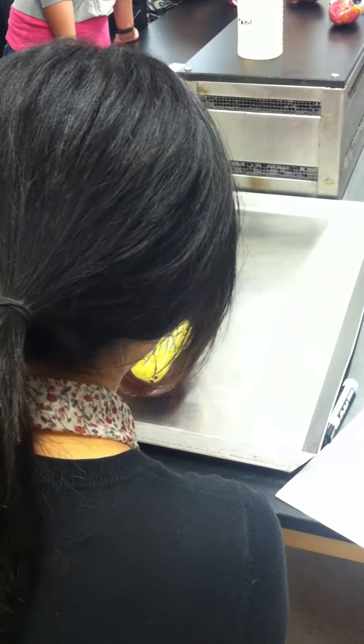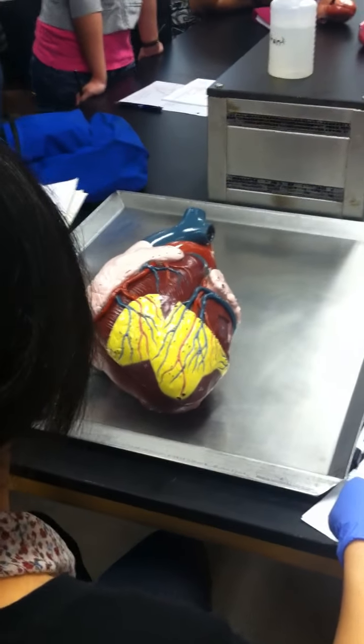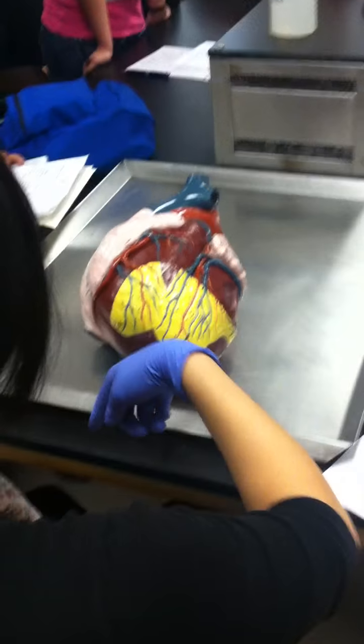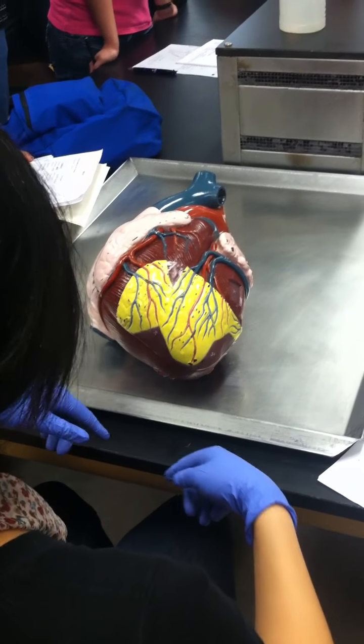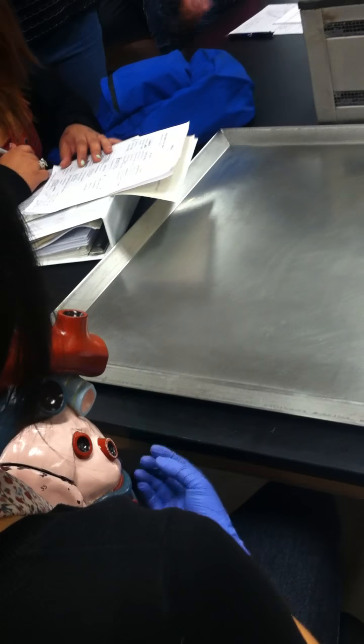Phrenic nerve. Esophagus, we know where it is, so be able to identify that. Sympathetic trunk, azygous vein, hemiazygous vein. I'll show you as we go. I'll probably go around per table showing you where the azygous vein and hemiazygous vein are, and I'll talk to you about that in detail. And the dorsal aorta is just the aorta descending down on the back side.